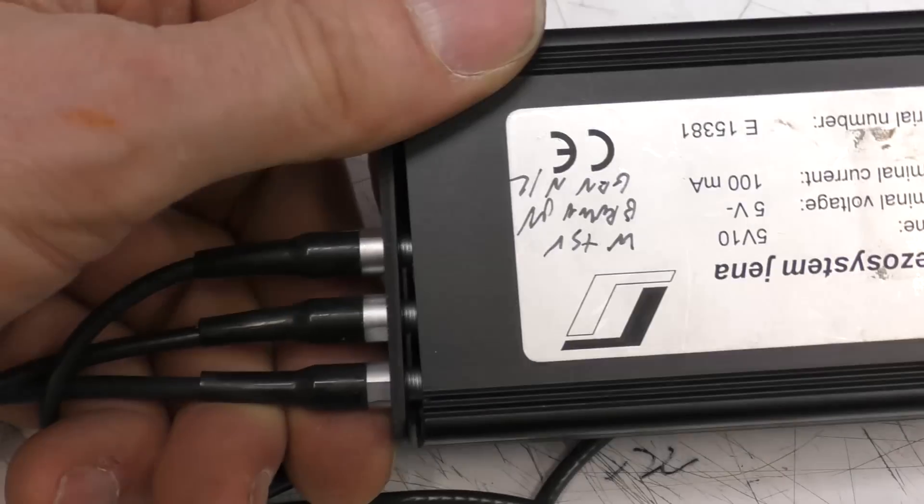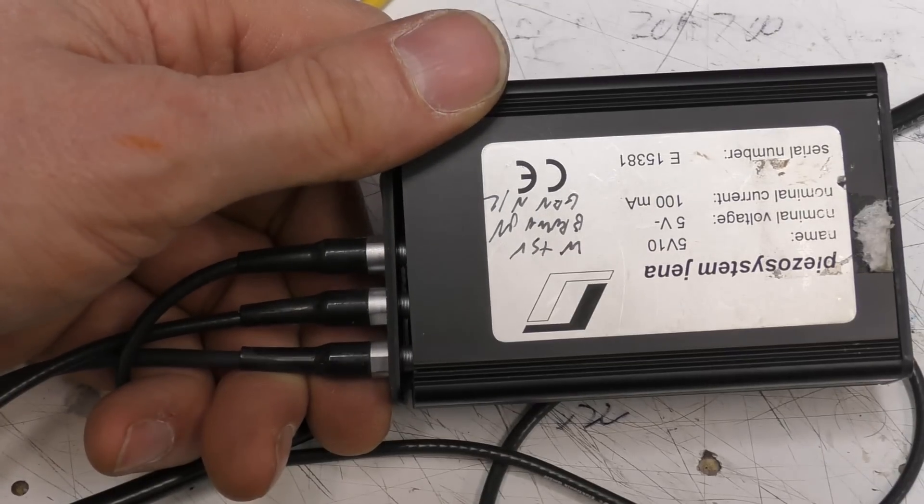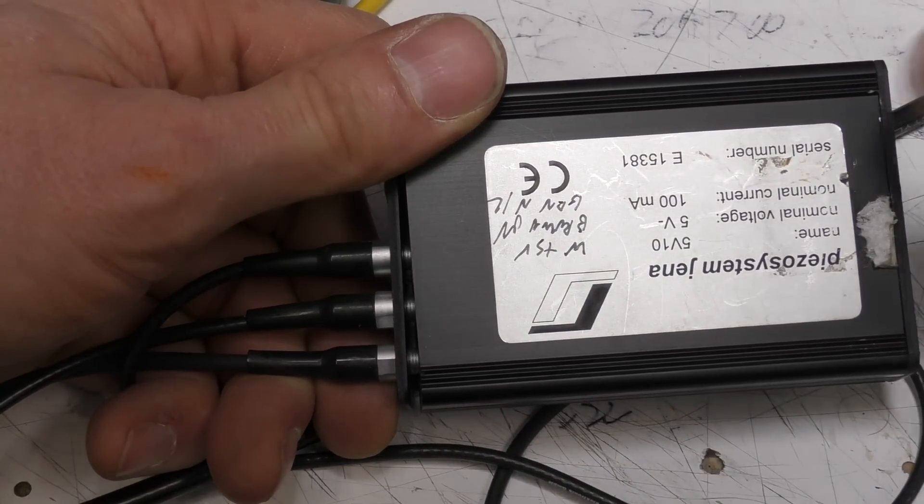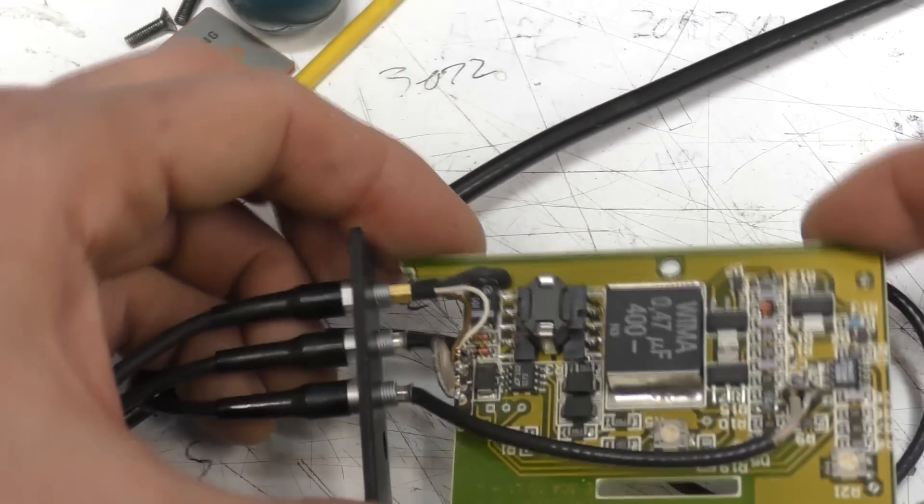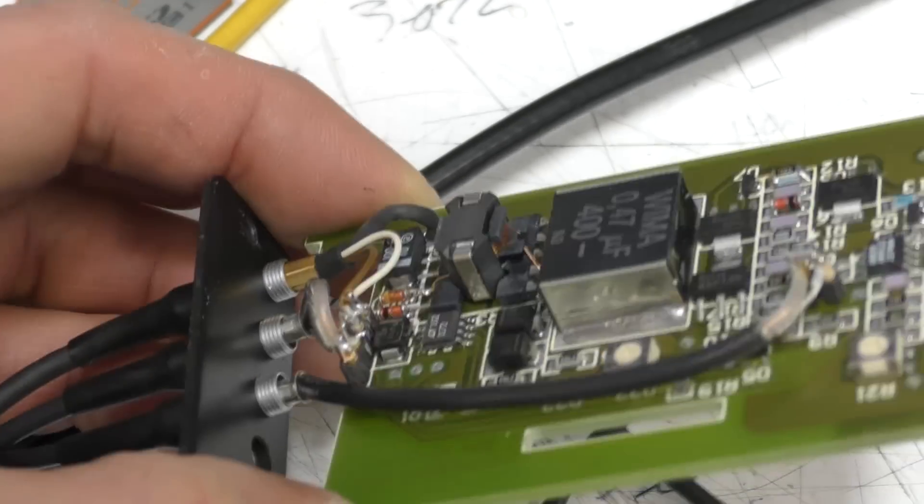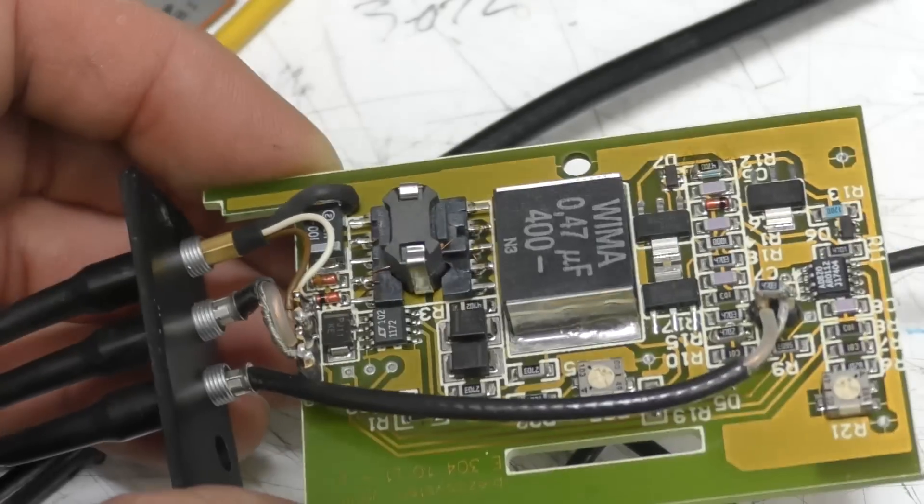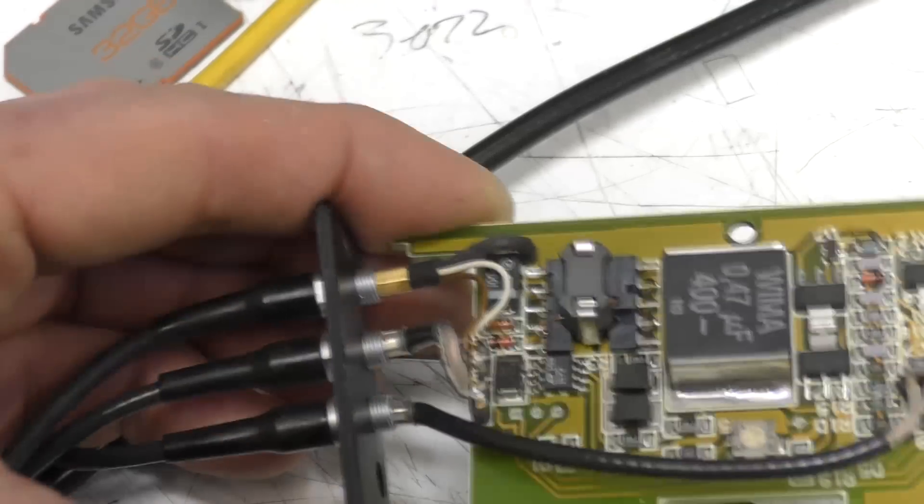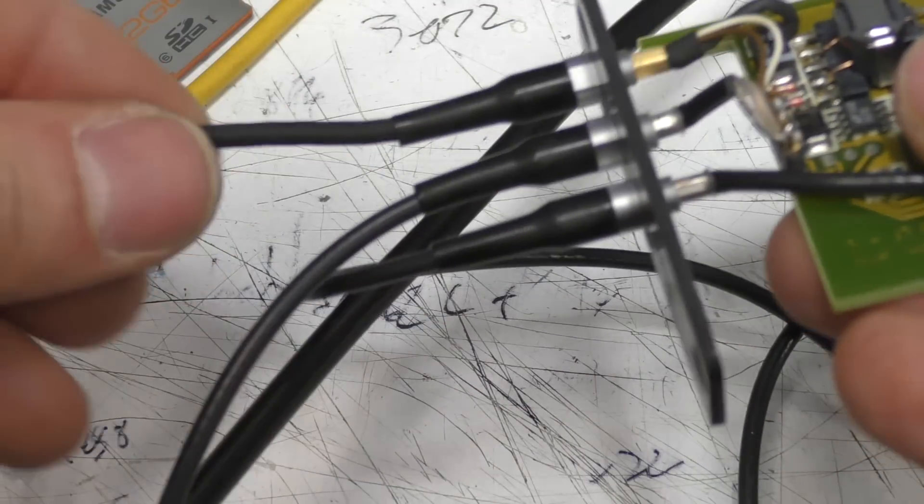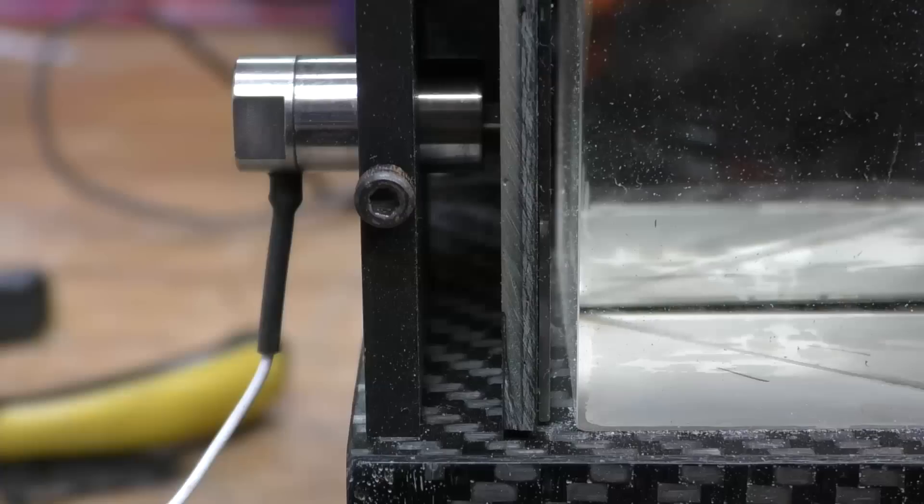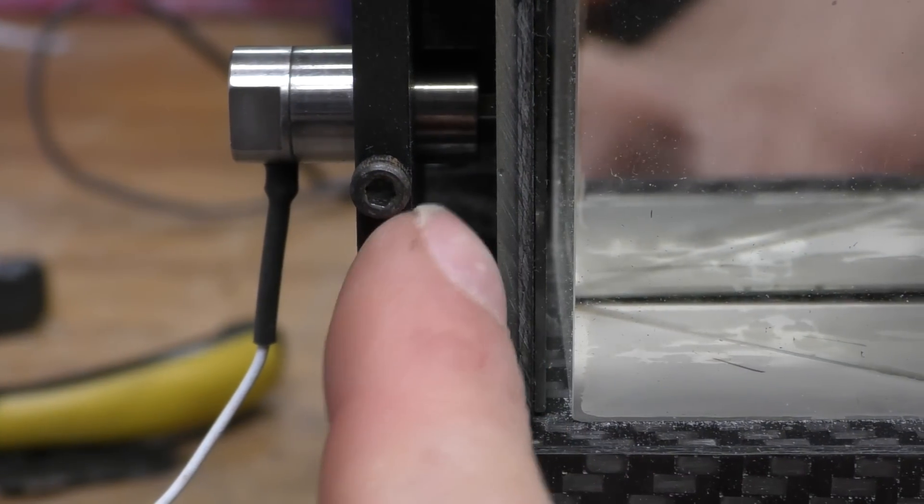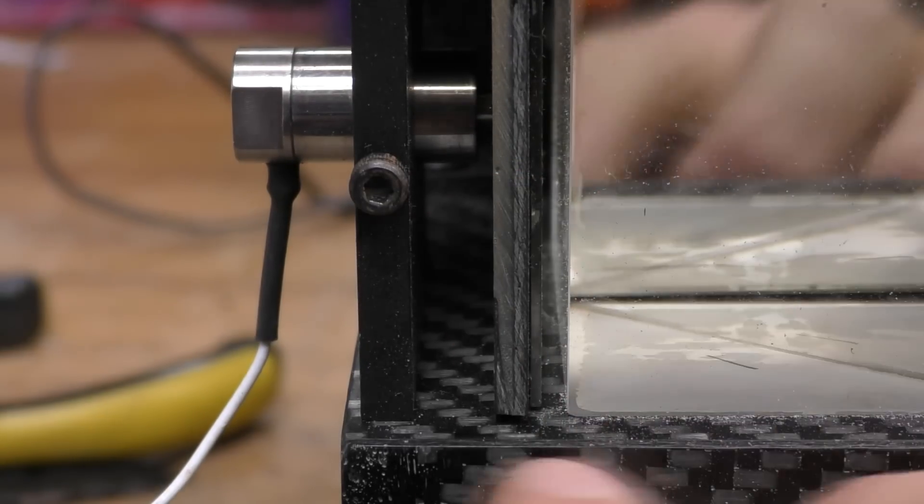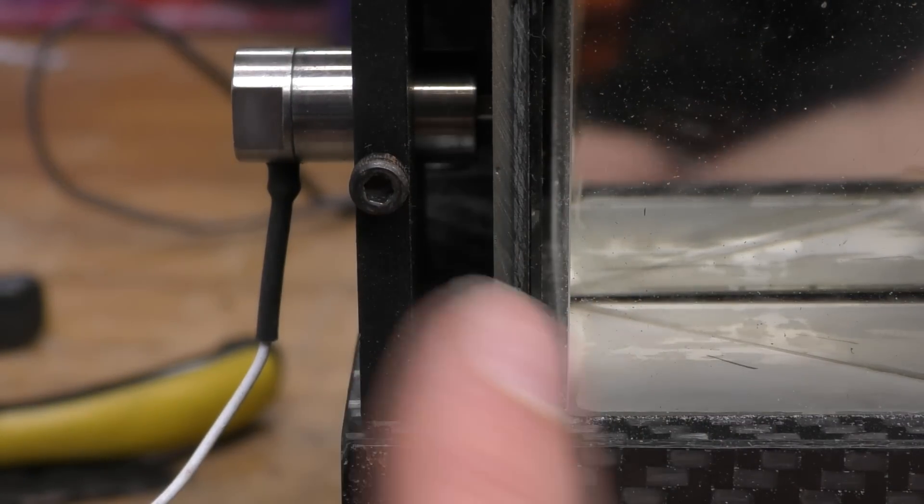This is the amplifier for the piezo actuator. It's a fairly simple device - five volts analog in and it produces up to 150 volts out to drive a piezo, but very low current, so it's fairly straightforward analog stuff. Although there's a rather impressively large surface mount capacitor there - never seen anything like that big before. It's got the outputs of the piezo powering at five volts and the signal in through these again rather expensive Lemo feed-through connectors. It looks like this piezo actuator is just putting pressure on this mirror assembly. I'm not quite clear - I'm not sure if the mirror's mounted to it or whether there's a plate here that it's flexing.